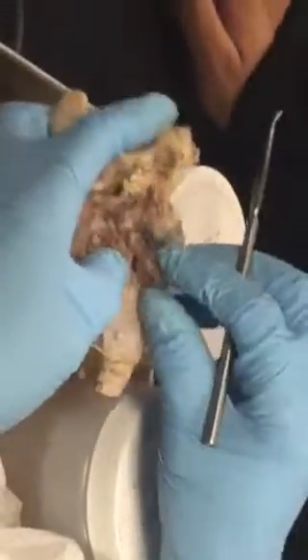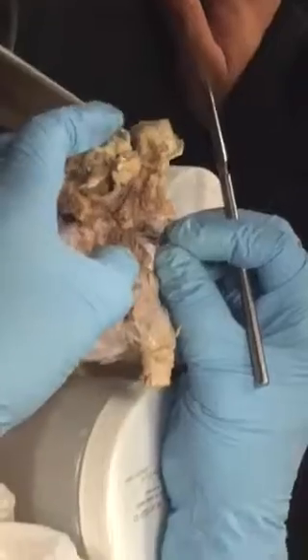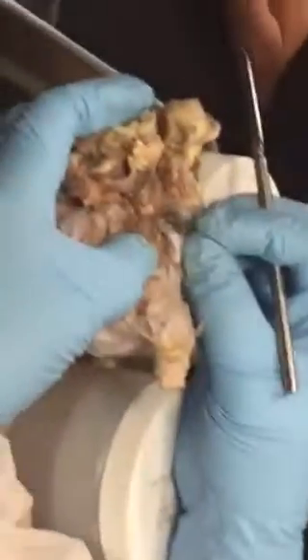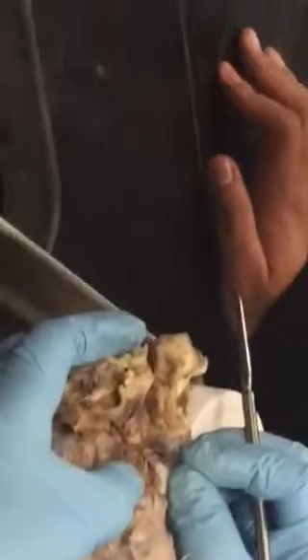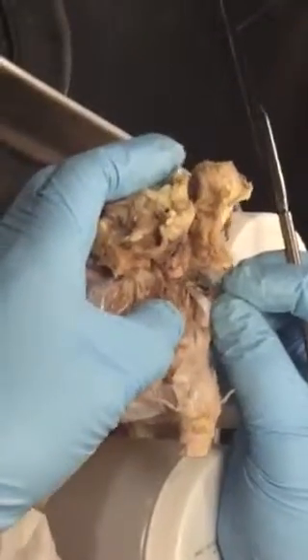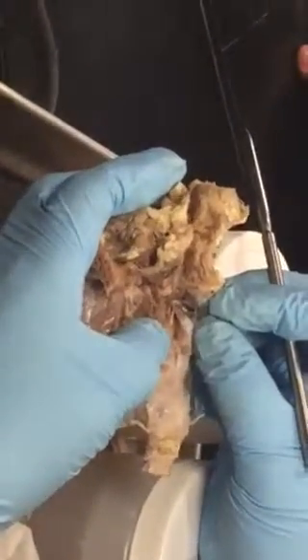Now here, on this side. Do you see it? Okay, do you see it? This is the base of the oculomotor nerve within the meninges, and then it will get out of the meninges layer. So usually, if you take off the meninges layer, this nerve gets broken off at the base. Can we keep moving on? Okay.